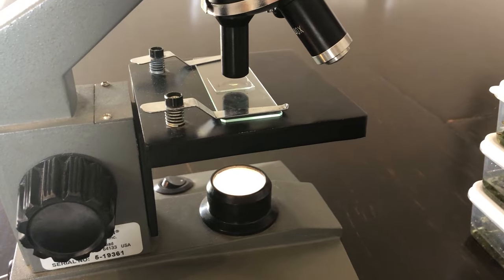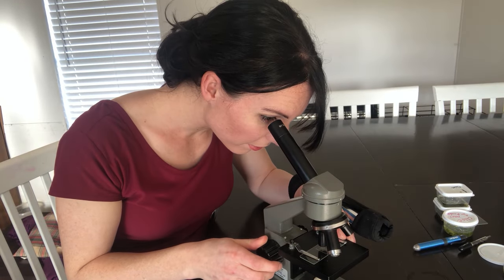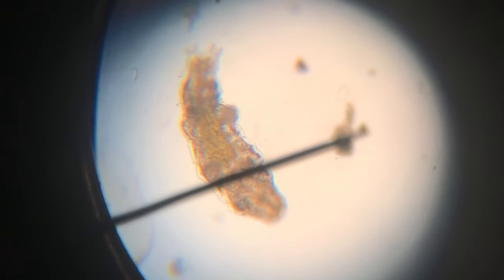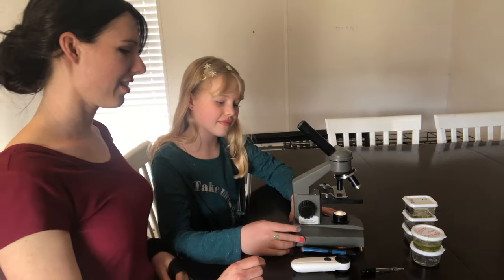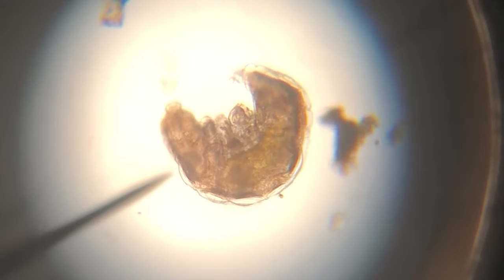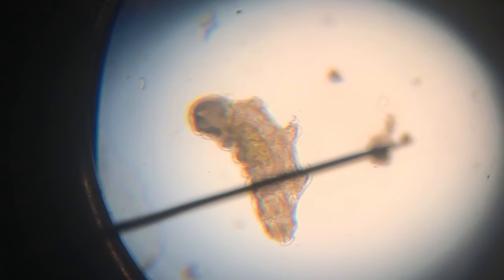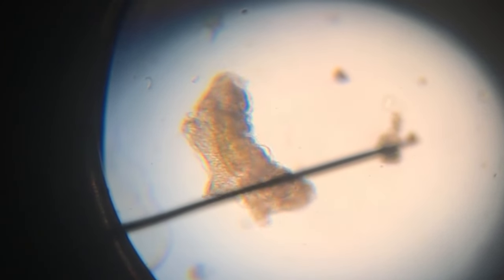Now I'm finally getting him under my compound microscope since I actually have a tardigrade to look at. And there he is! They are so cute — they're even cuter in person. We absolutely had a total blast with this project and I highly recommend you go on a hunt for tardigrades. They're seriously adorable and their claws are easily distinguishable through the microscope, and you can see their cute little snout. They just seem really, really fun.